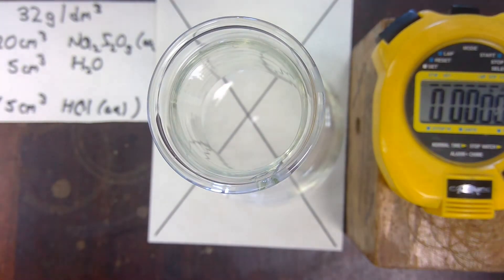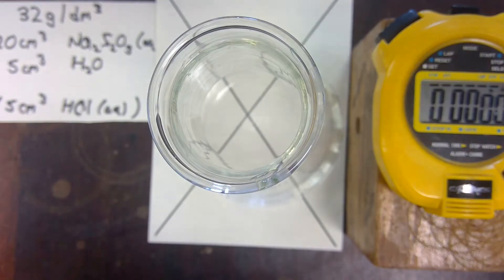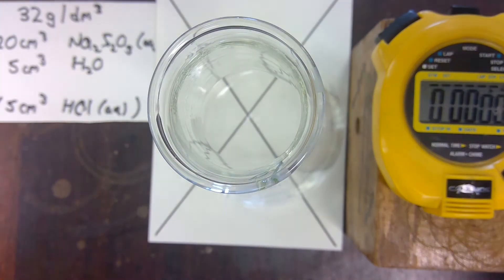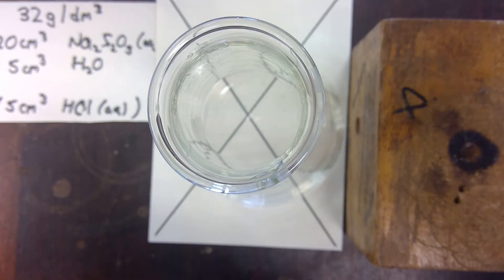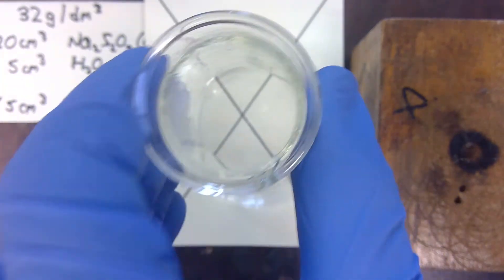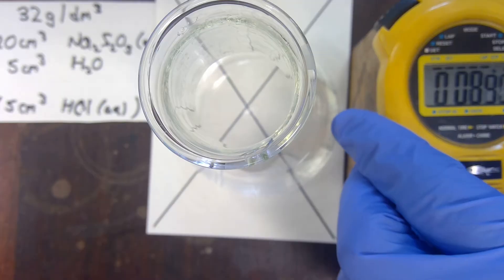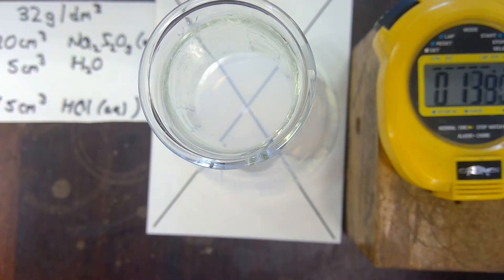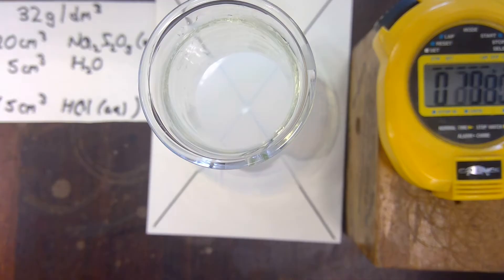The experiment is exactly the same and you will need to measure the time taken for the cross to disappear in seconds to the nearest second. So, the second experiment — as I add the hydrochloric acid, I will start the stopwatch and then swirl.